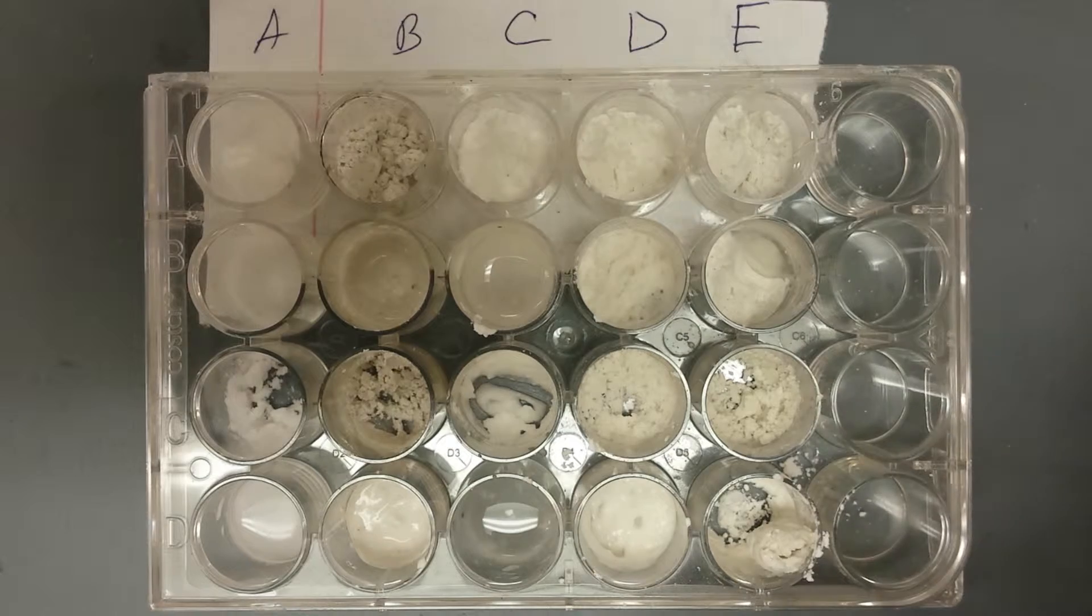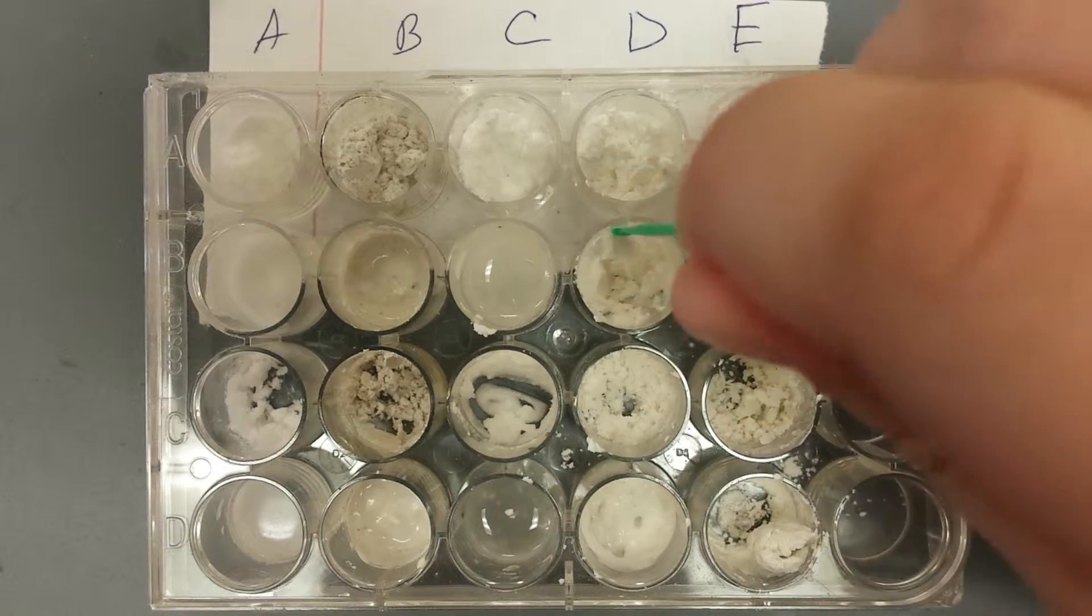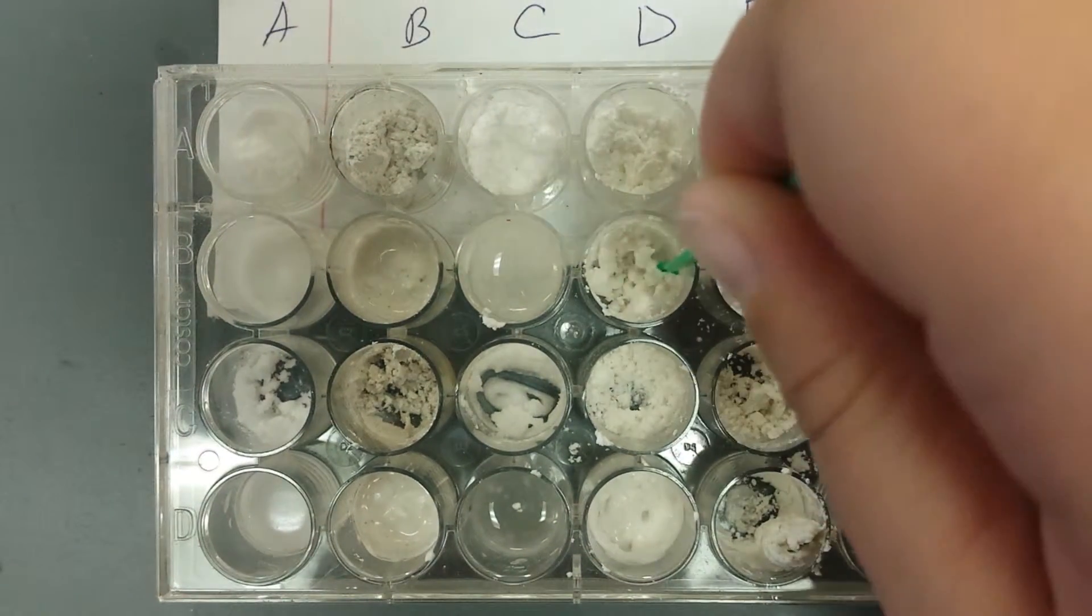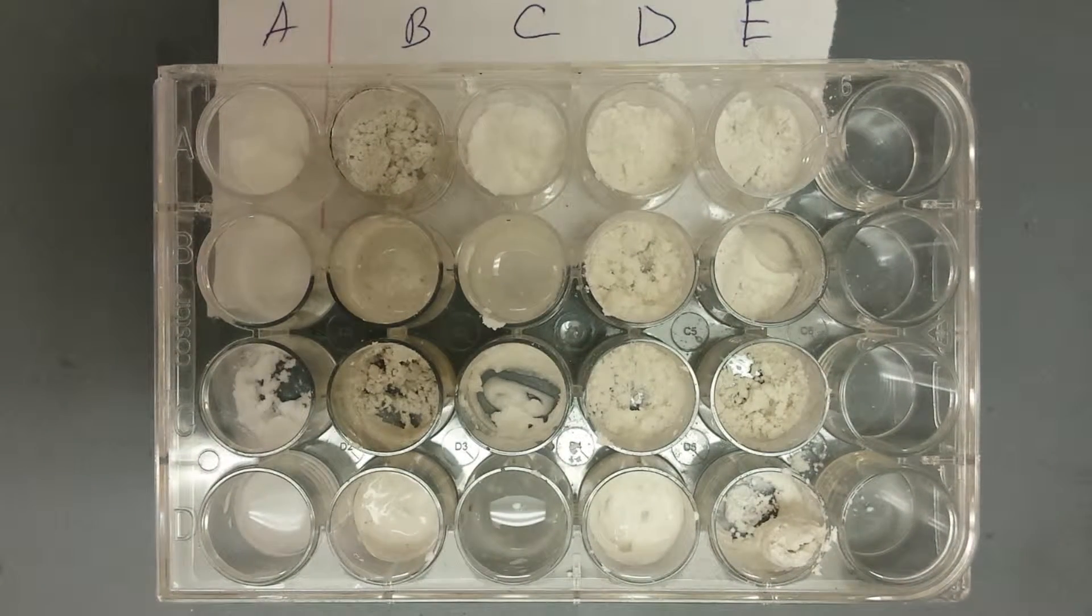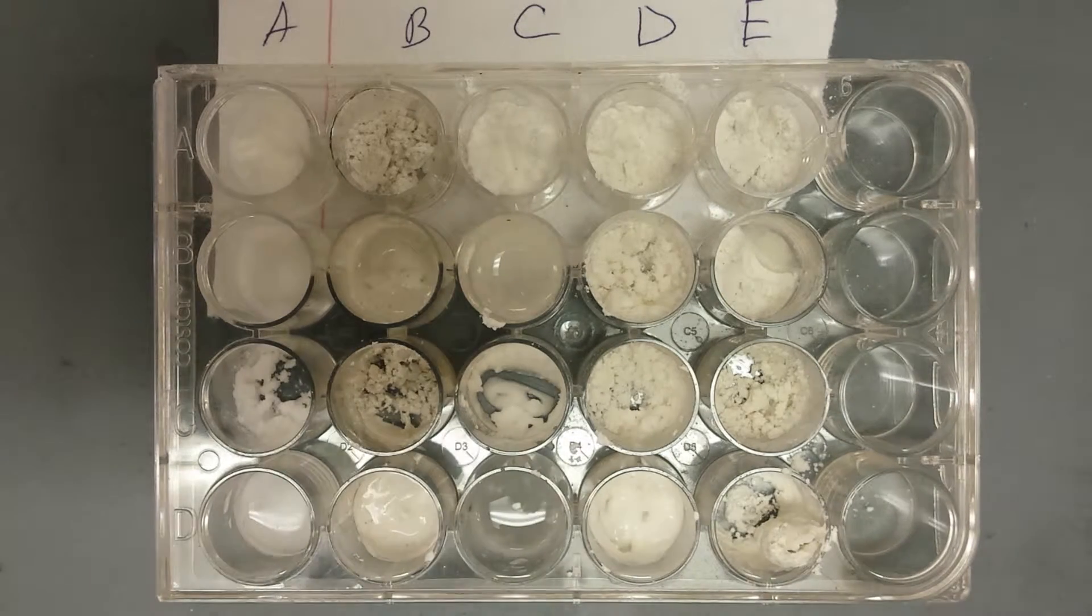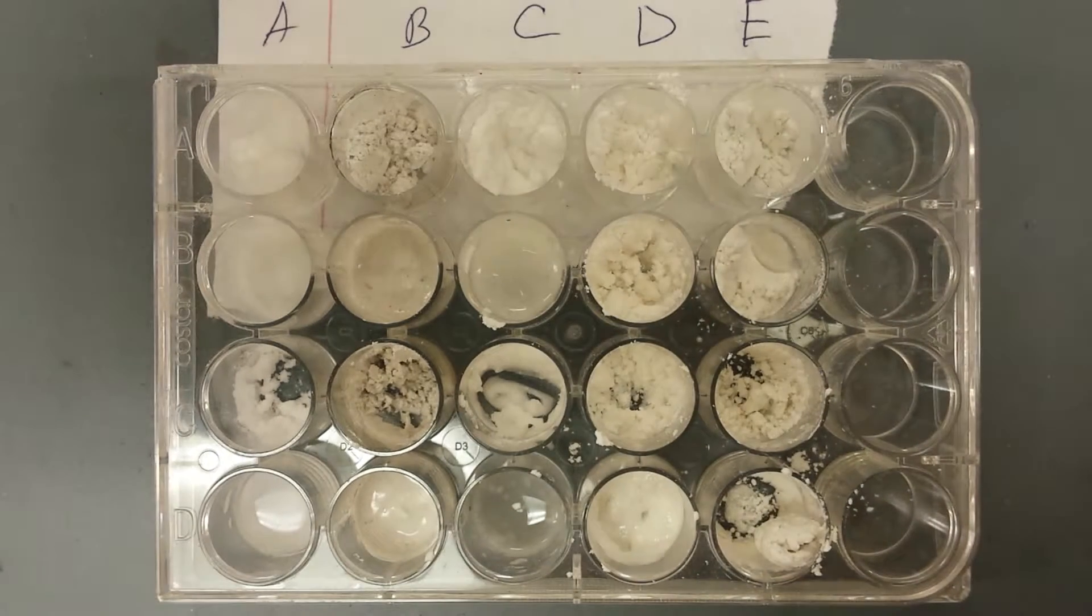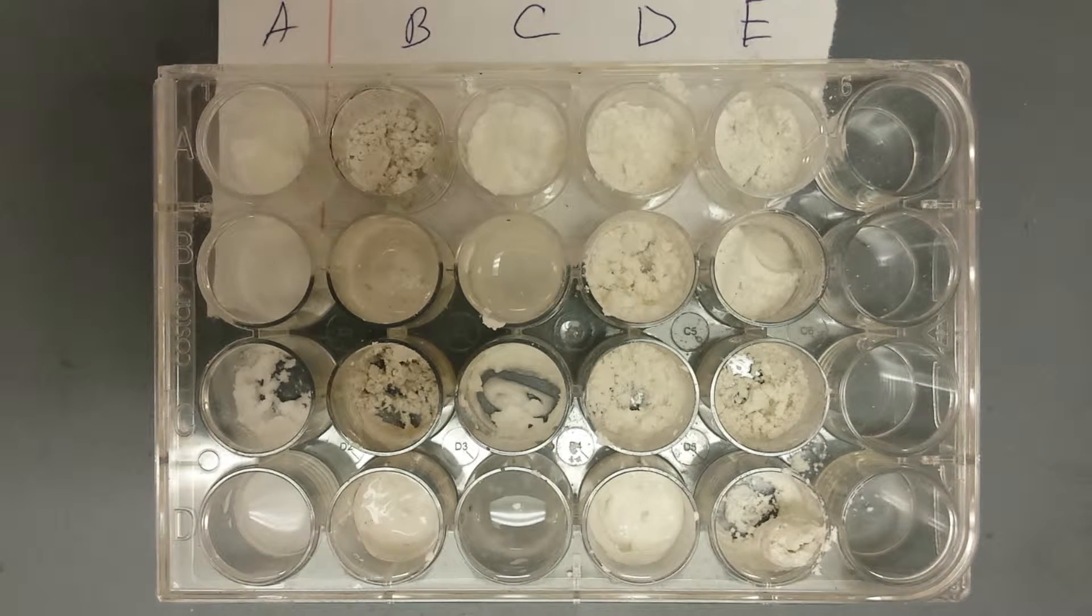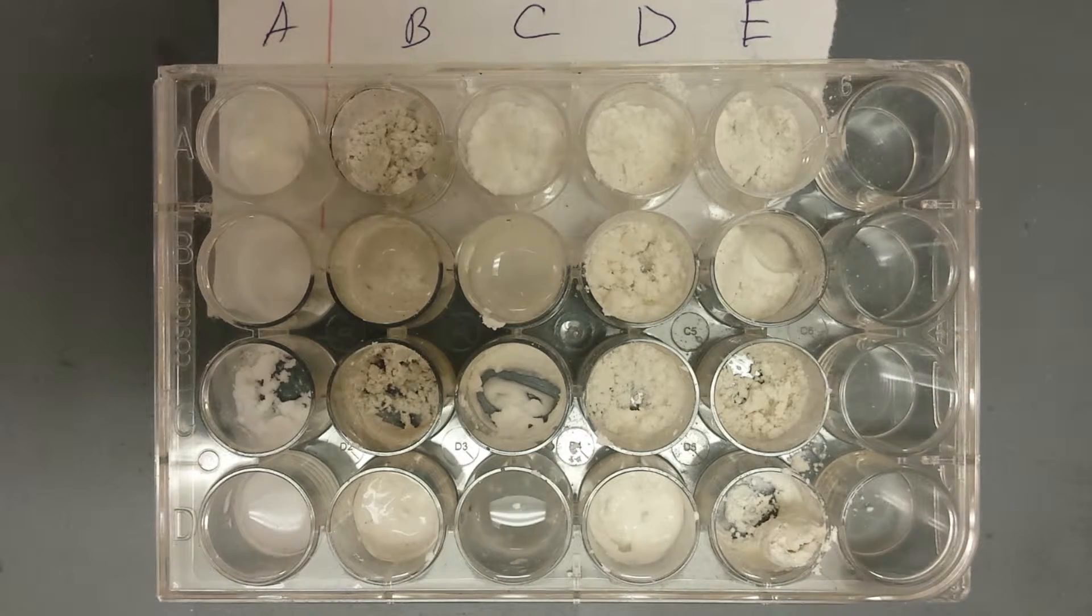Do you know if there's still an indicator? I don't know what we should... I guess we have plenty. Say how much we should... he has plenty. Whoa, that got really like thick, clumpy, really dry. What one is that one? D. Yeah. So it fizzed... oh wait, E fizzed a lot wasn't it? No, D fizzed. D fizzed but it clumped after that. It fizzed a lot. Then clumped. Then clumped.